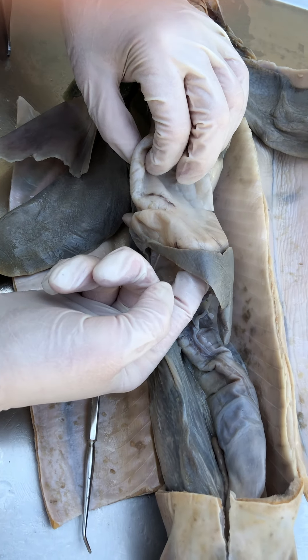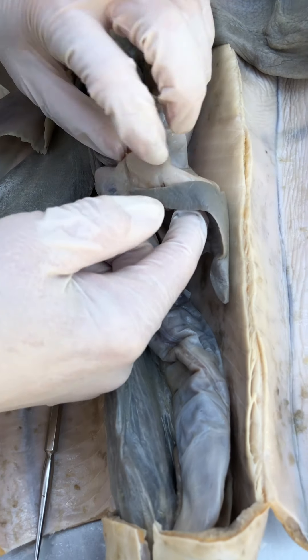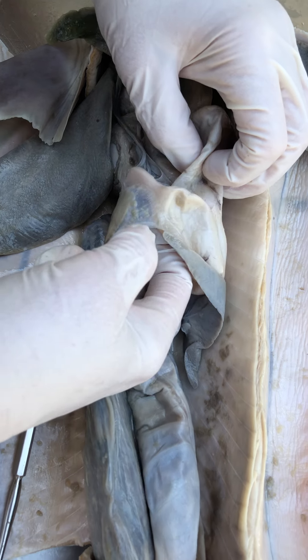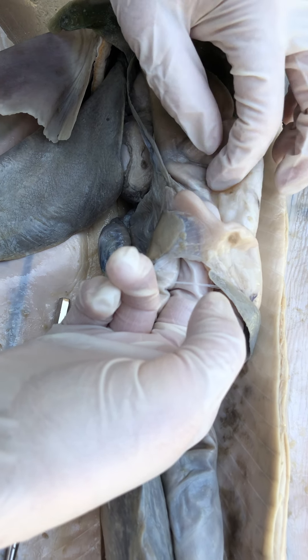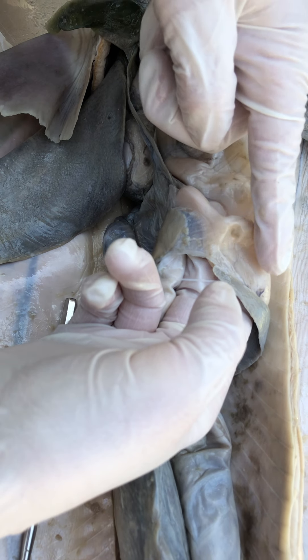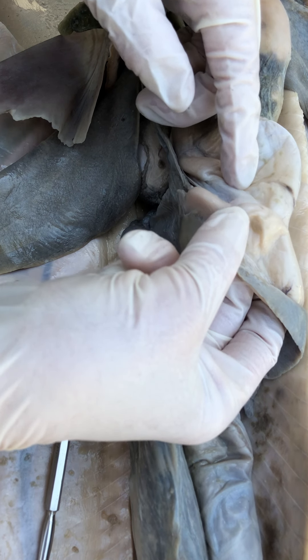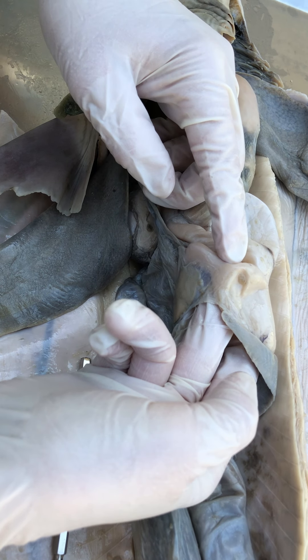The stomach takes a bend, and at that bend we see the spleen, just like in the pig and in us. Rolling it over, we have the stomach, a curvature, and then a muscular knot — that's the pyloric valve, the pylorus.